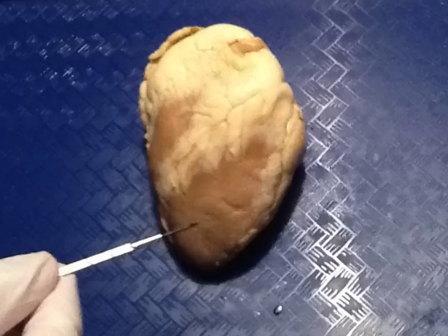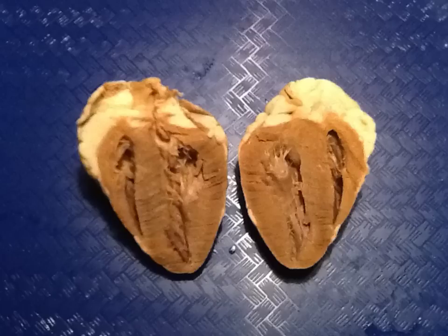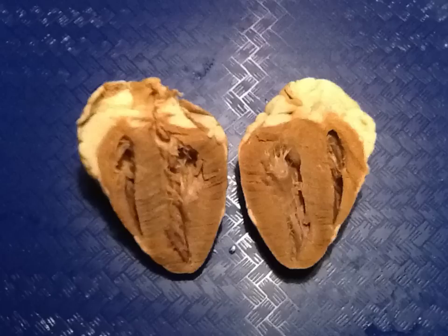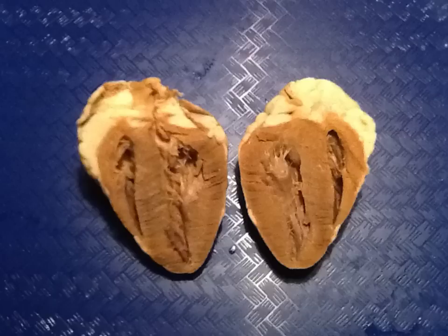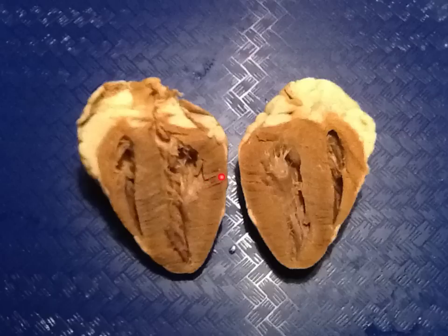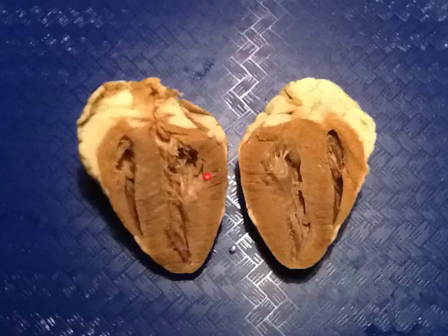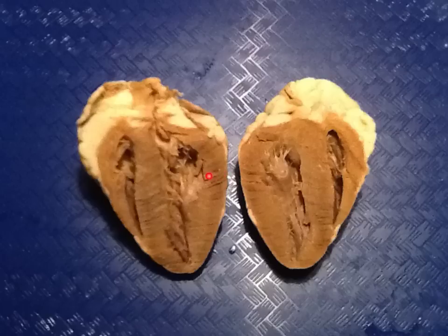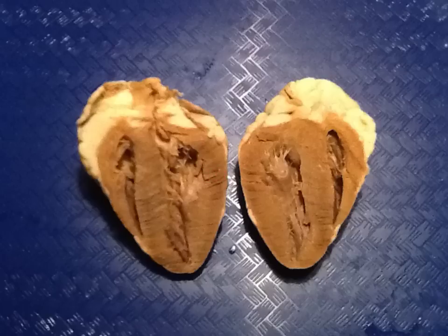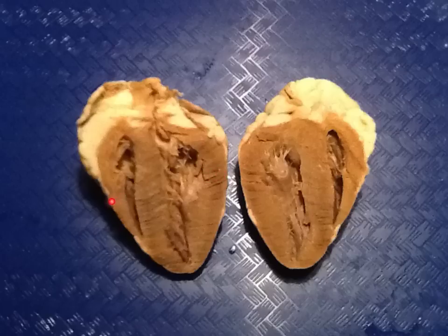Now let's have a look inside. As we look at the inside of the heart, first let's learn how to determine the left side from the right side. Notice the distance or the thickness of the wall — here it is very thick, and over on this side of the heart, it is thin.